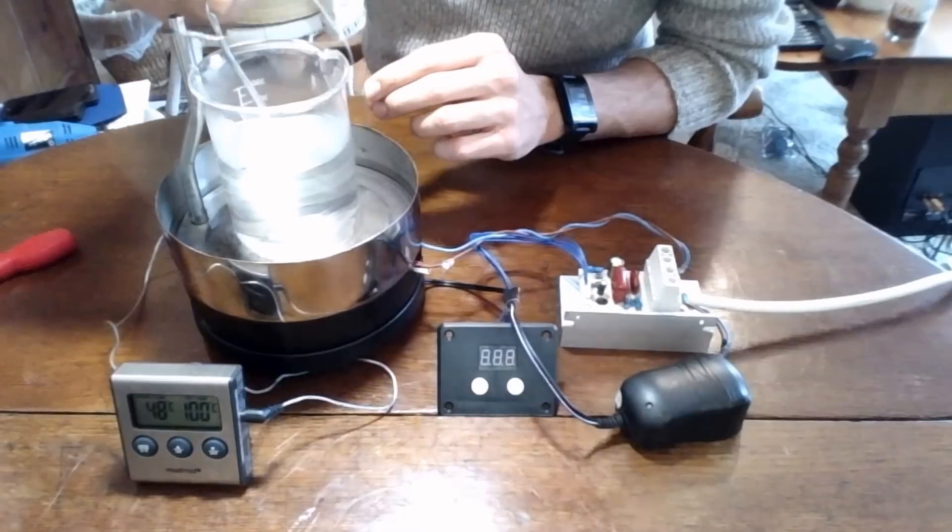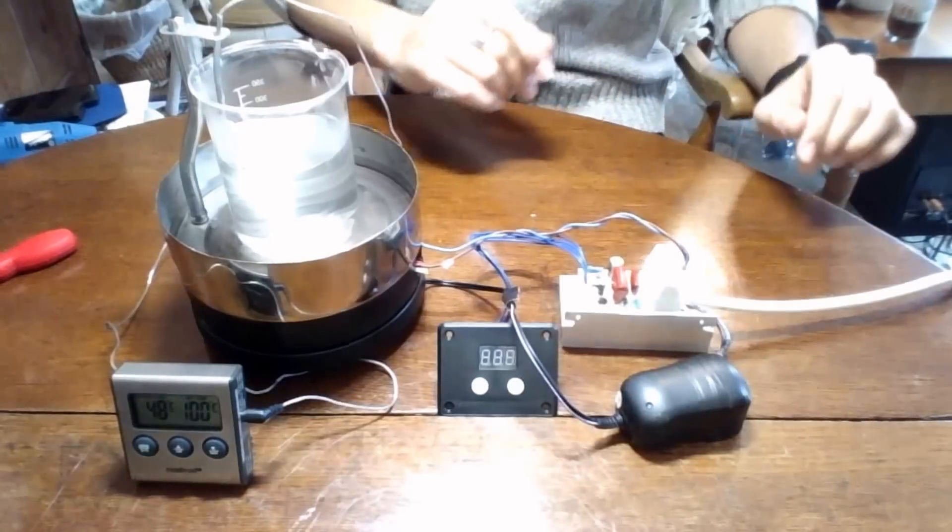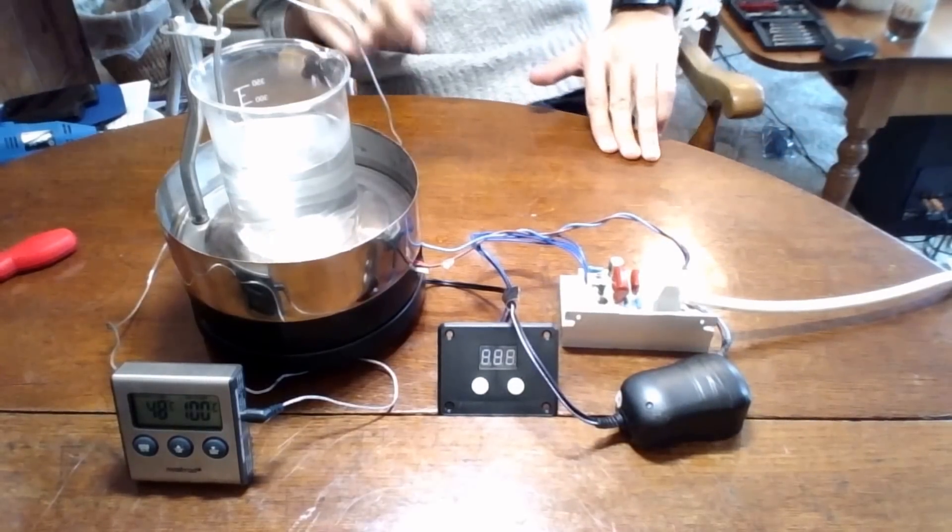And a nice temperature probe to tell us how hot our fluid is. Sorry, this is a little bit fidgety. Perfect. So let's just plug that in and see how it works.